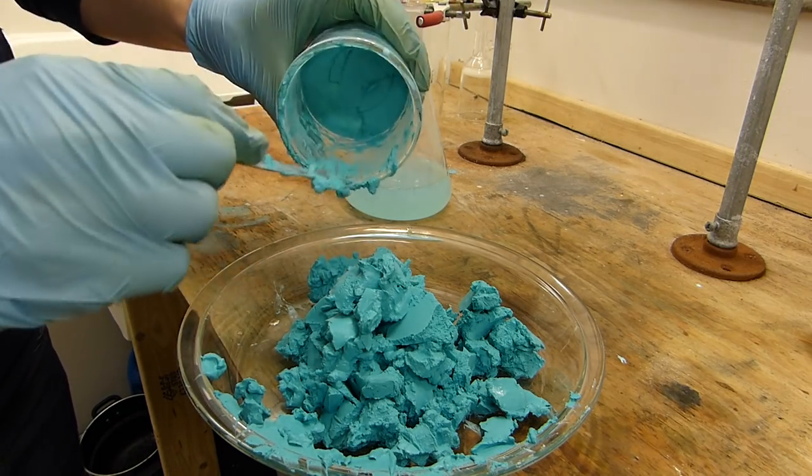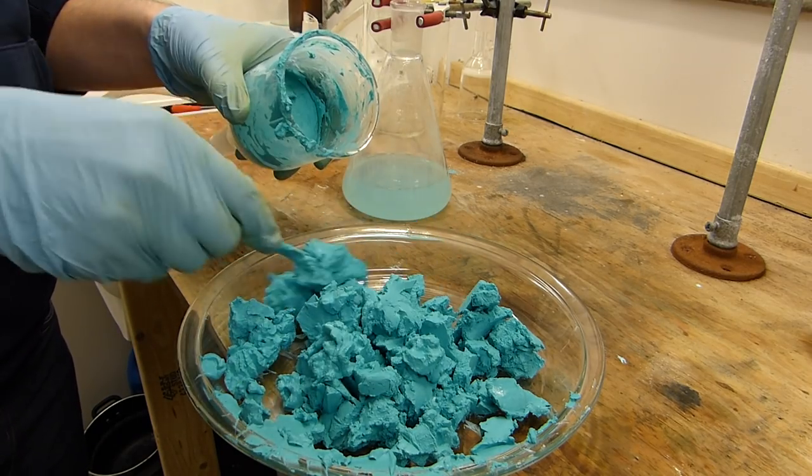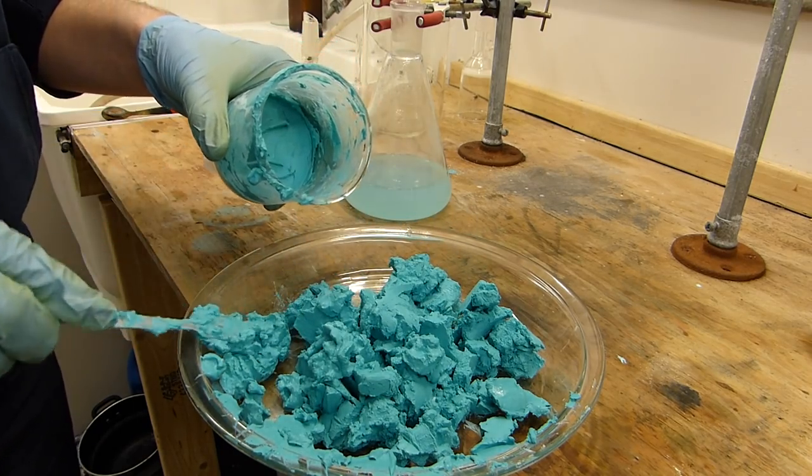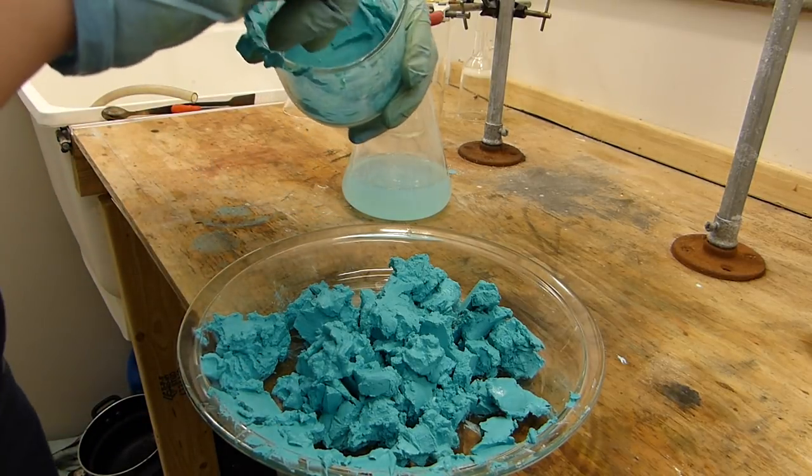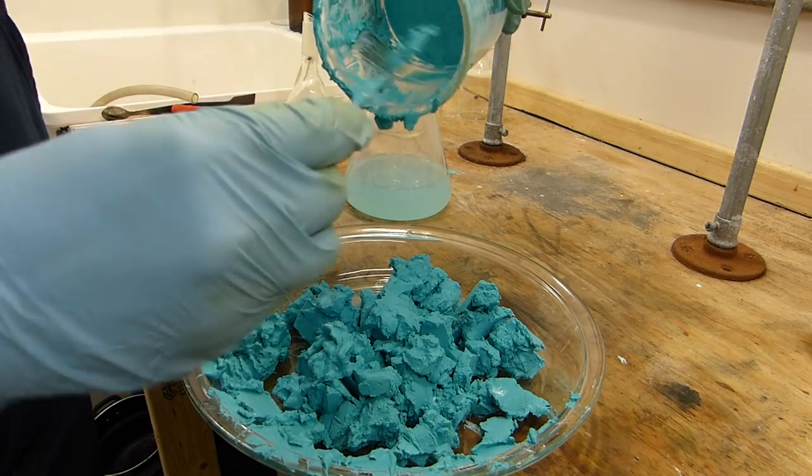So you may be familiar with this method, I used it in the nickel oxalate preparation. We're just going to take this pasty mix here and put it on a hot water bath, which will accelerate the drying of this by quite a lot. And by the end of the evening, I should have some dry powder.